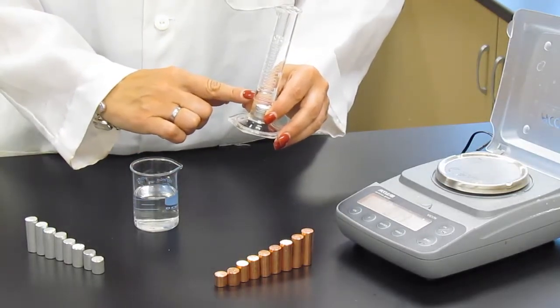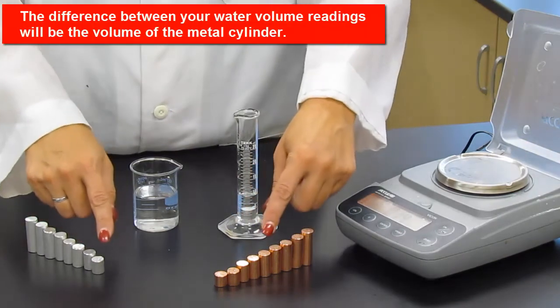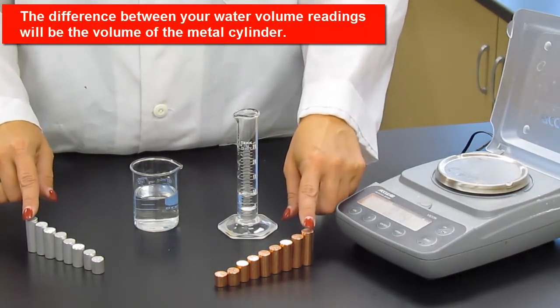Then take a final reading, making sure that once again you're using the correct number of significant figures. Complete this for all 18 cylinders.